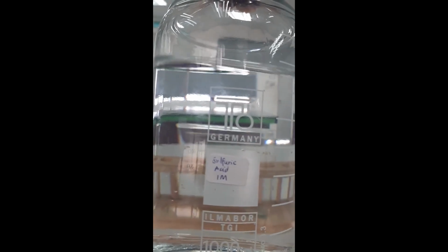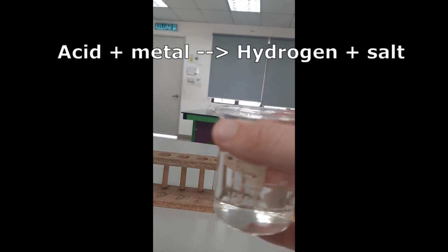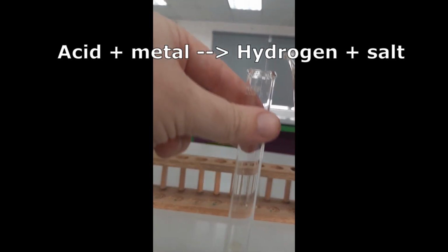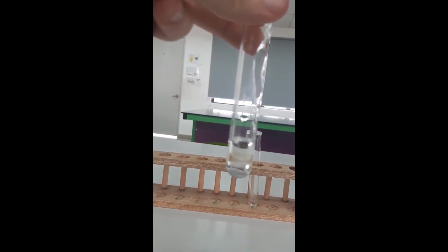And then what I'm going to do is add sulfuric acid, H2SO4, to that zinc. You will know that zinc, or any reactive metal, reacts with sulfuric acid to produce hydrogen gas. So what we should see here is bubbling. So that bubbling that we can see there, if I can get the camera to focus, there we go, the bubbles you can see there are hydrogen gas being produced.